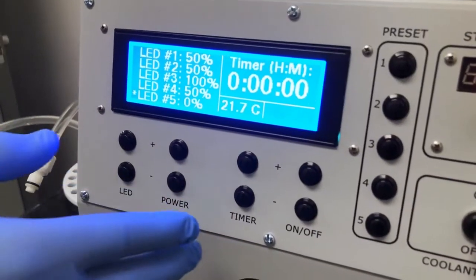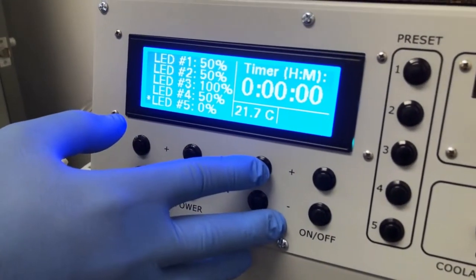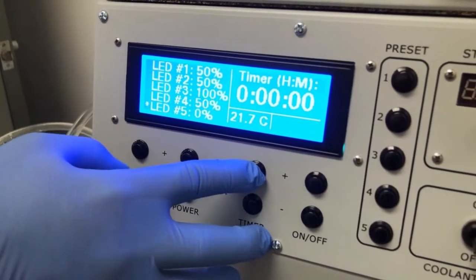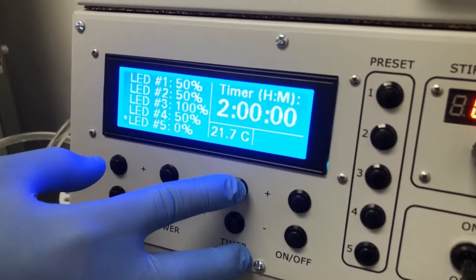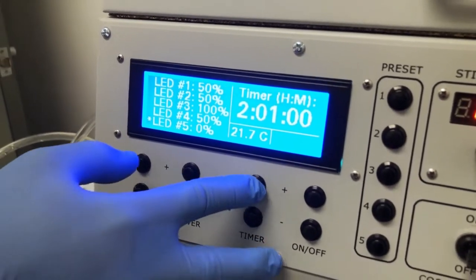As we move left to right across the Lucent 360's operation panel, you can set specific reaction times and pause the reaction counter when necessary. Under the timer is the temperature gauge to indicate the temperature inside the reaction chamber.